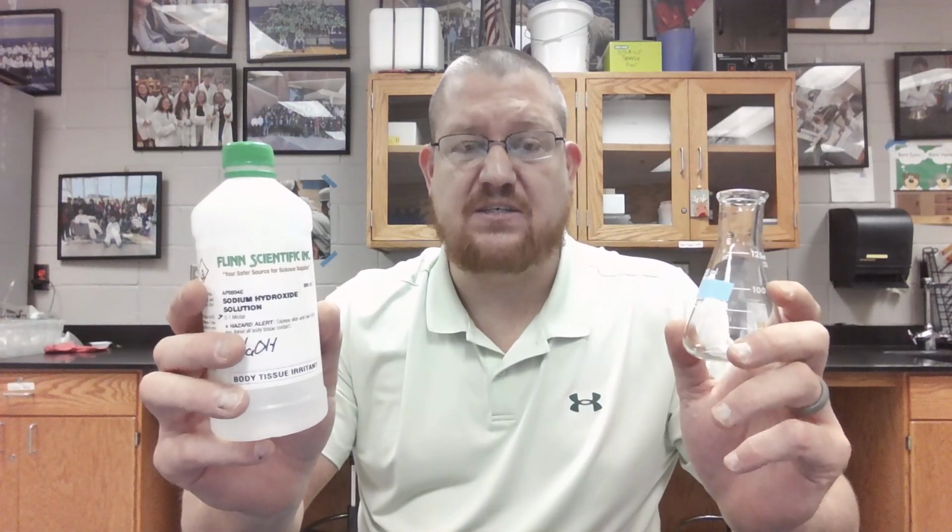So in this video, we're talking about how to make a label if we want to pour solution into this glassware. This is just pouring the solution in here. We're not mixing it. We're not making a new solution. We're just maybe putting it into a more manageable container for the lab that we want to do instead of having used the whole bottle. So part two of this video is going to be actually calculating and making a solution and the label component of that. So kind of like the complete process if we needed to dilute a concentrated solution for a lab or something of the sort.